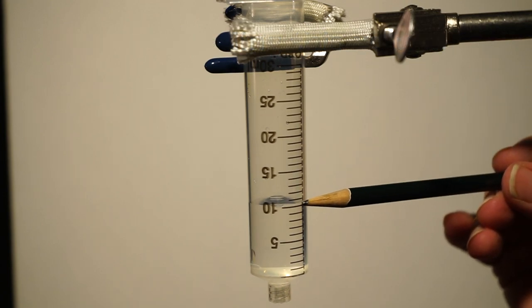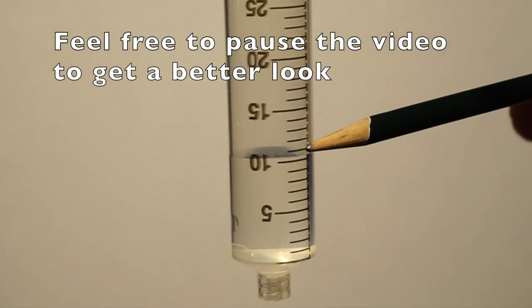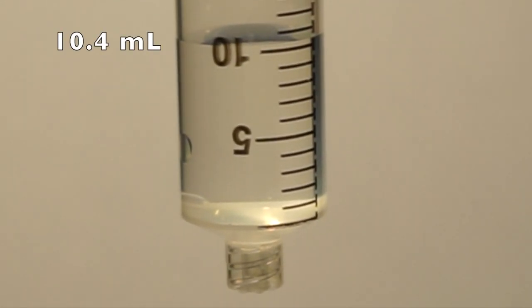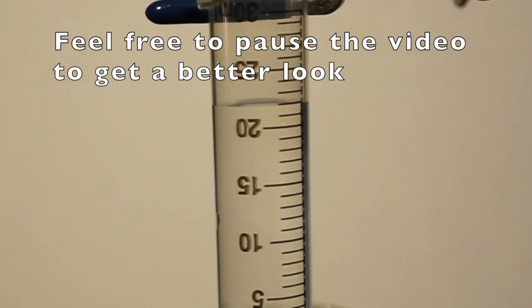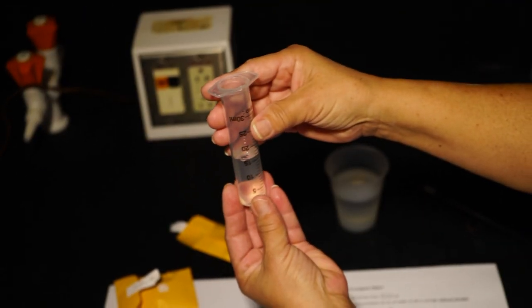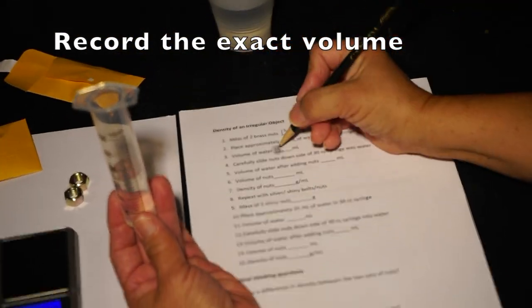What is the volume in this case? It is 10.4 milliliters. What about in this case? It is 21.9 milliliters.